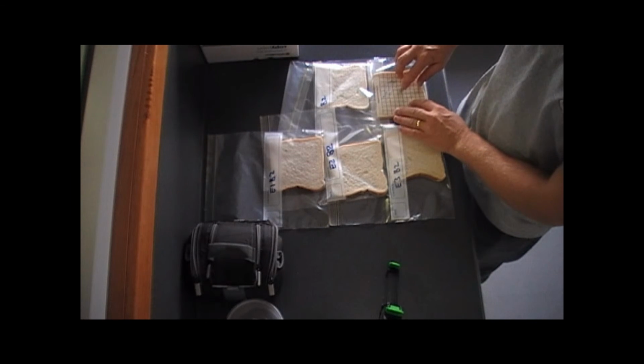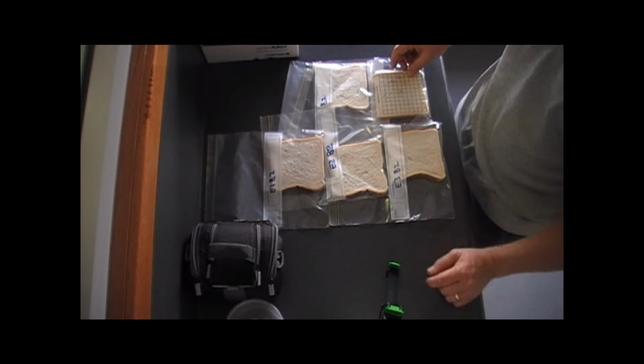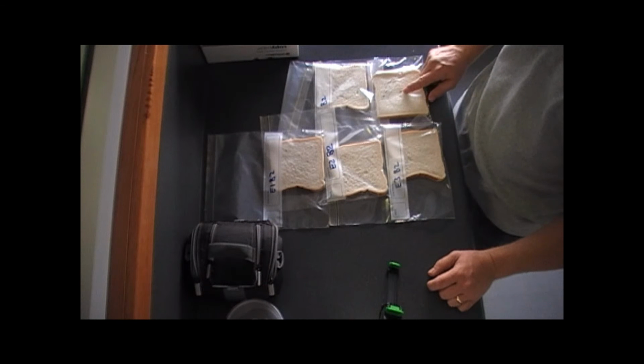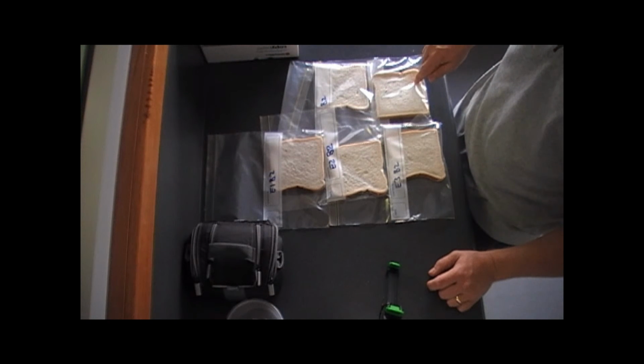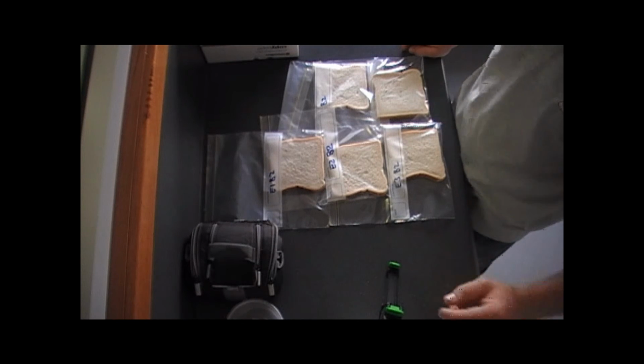Again, it doesn't quite fill a square centimetre, so it's not a score, but worth noting. So that's experiment 5, repetition number 5, in the condition of room temperature.